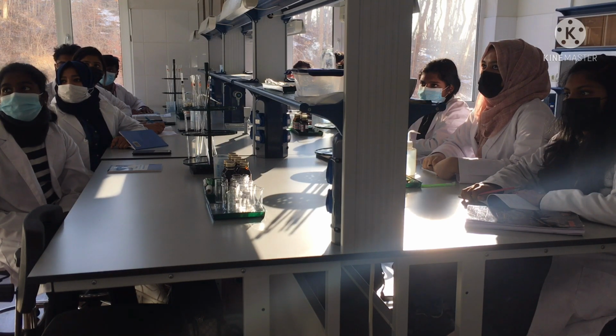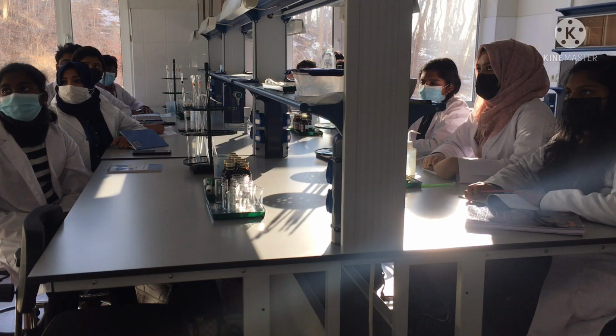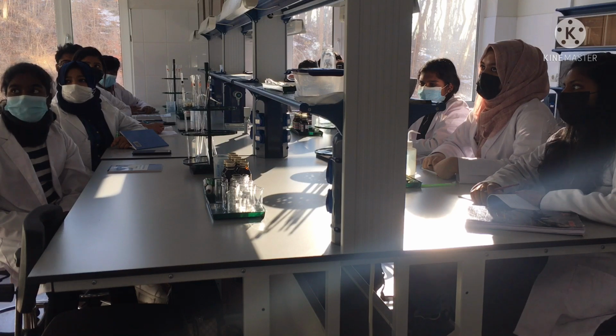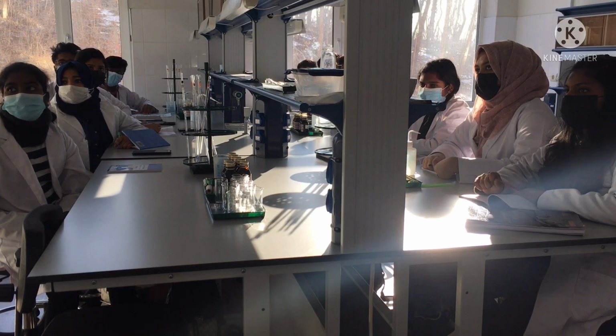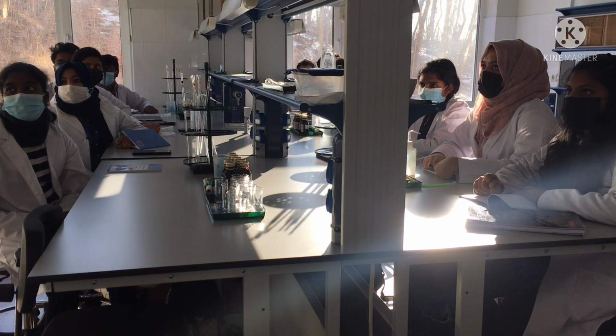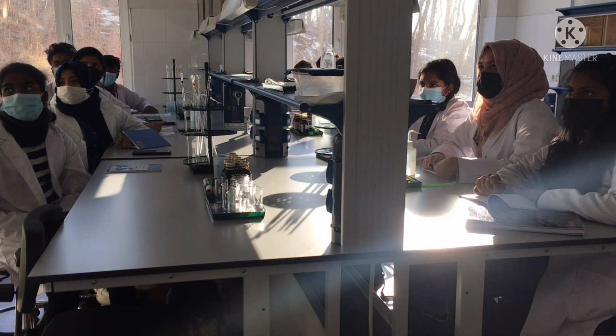So, as I said before, in the first series we will study the influence of different amounts of components. We will vary the volumes of components. In the second series, we will study the influence of the catalyst. We will add the catalyst to the reaction. What is the catalyst? Who knows? What does the catalyst do in the reaction? Yes, it makes the reaction faster. Yes, good.